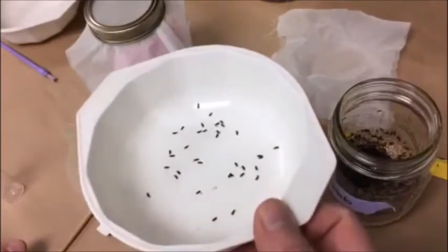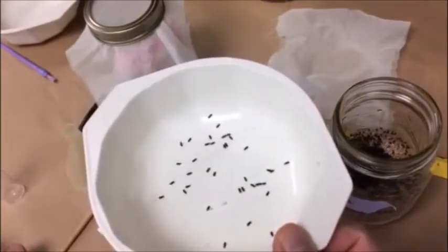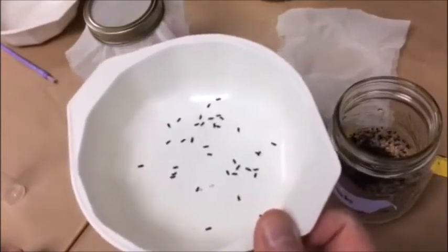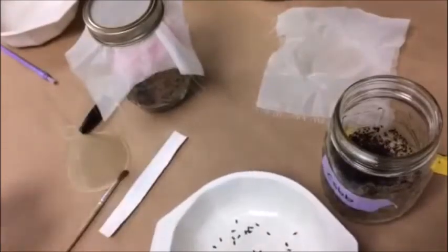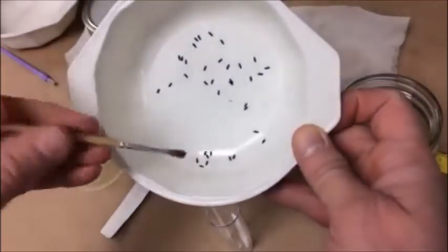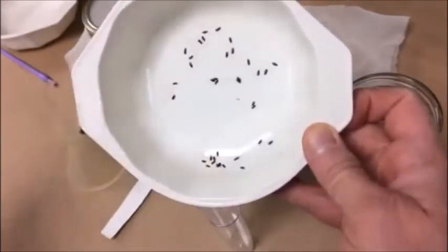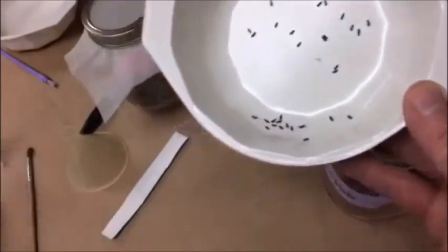One of the great things about these bowls is there is no way that the beetles can get out — they simply cannot climb up the side of the bowl. So once you get the beetles in the bowl, you can just relax and take your time. Assuming you have food in this vial, you can carefully count out the number of beetles that you want into the vial until you have the correct amount for the exercise you're filling the bottle for.